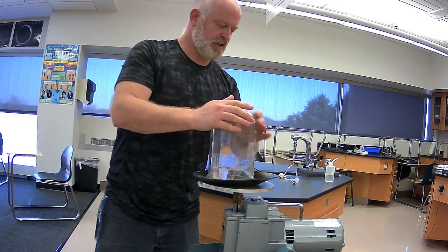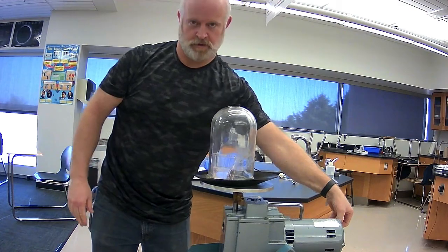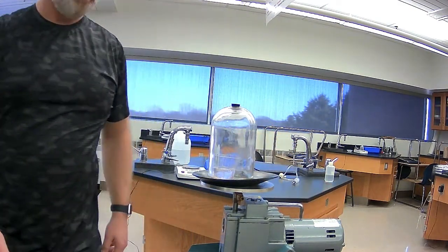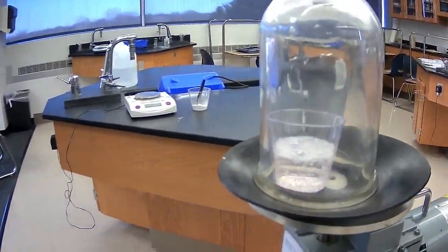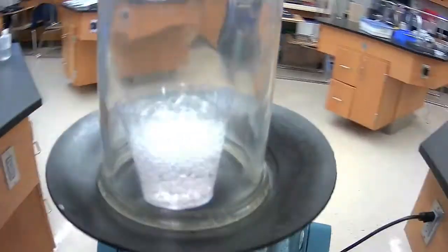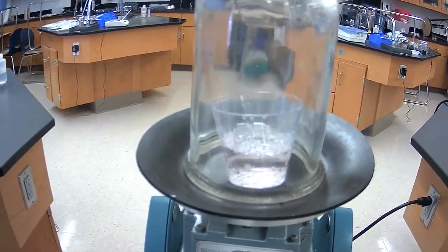Okay, seal that up really good. Close my valve again, and then we will again see what happens here. And very quickly, we see a lot more fizzing, very violent fizzing actually. Better turn that off. And we see what's happening here.